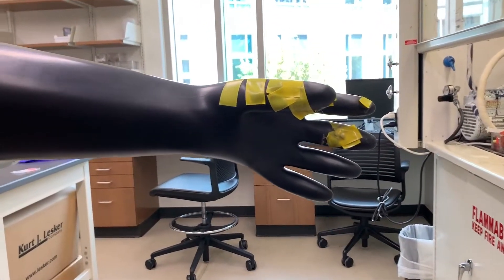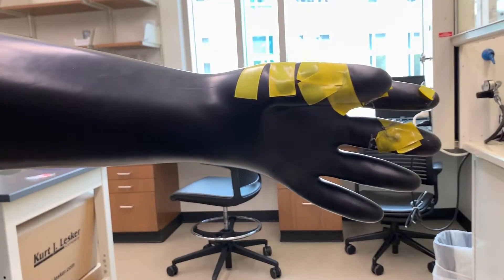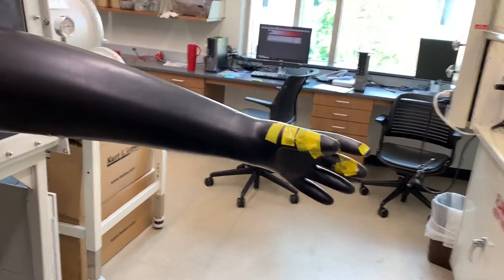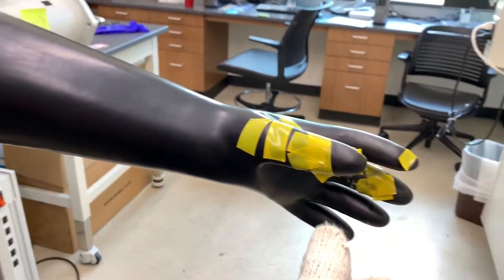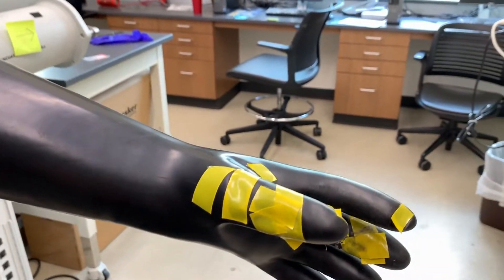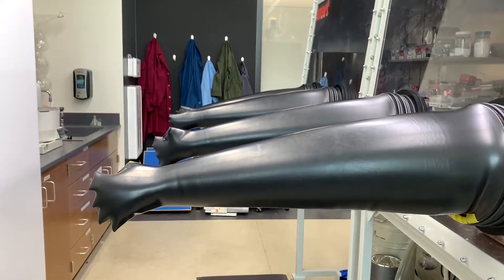Here are a few places where you can expect to find holes in a glove: the fingertips, especially on the right hand since so many of us are right-handed, the knuckles, and the cuff where the glove connects to the port. When a glove is compromised, sometimes it's enough to tape up the hole and get back to business. But other times, the number of holes or the size of the hole is just out of control.